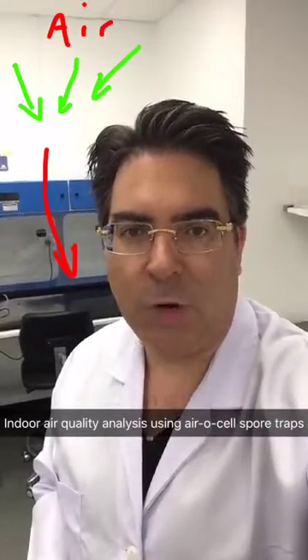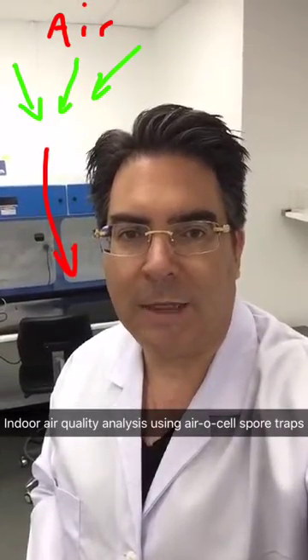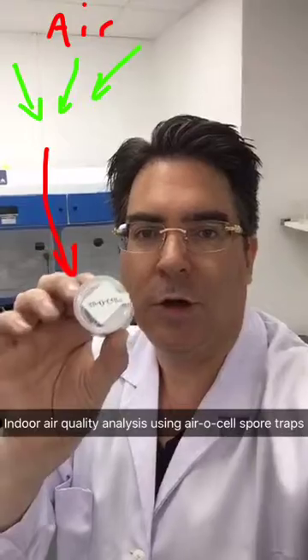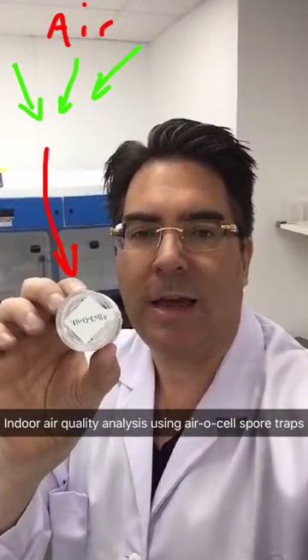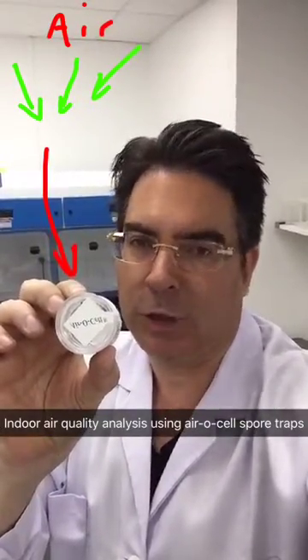I'm back at the lab again and this morning I'm going to be running through exactly the procedure that we use to quantify these aerosols to work out indoor air pollution.